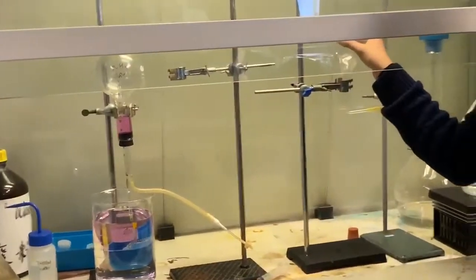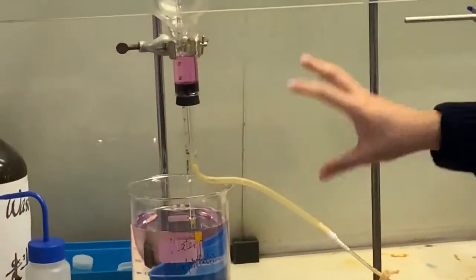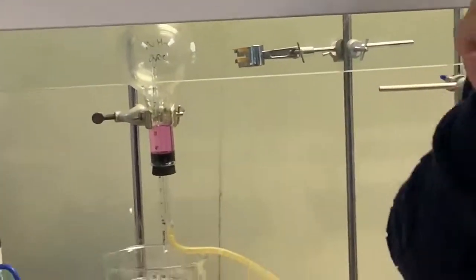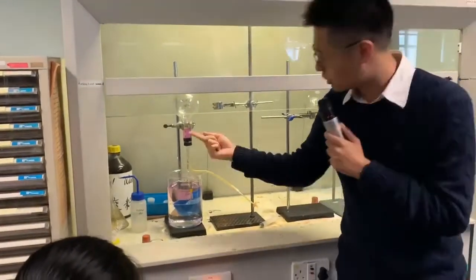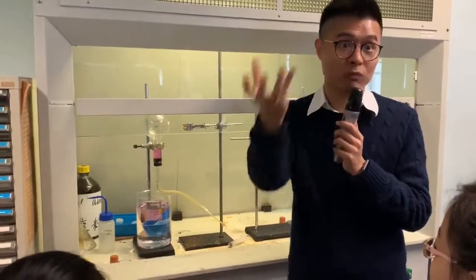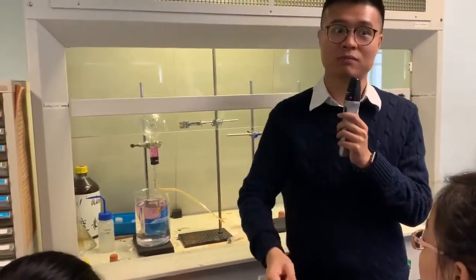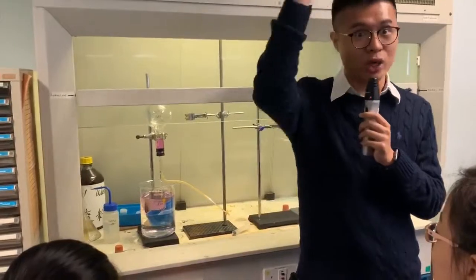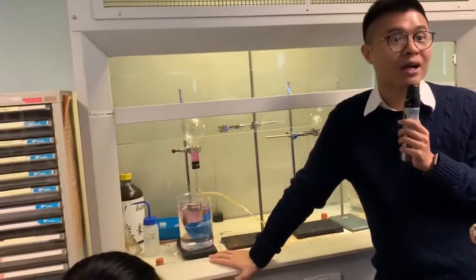So after we pack the ammonia, then we can do it. But what is the purpose, right? We check if ammonia loves water or not. It's like on here, you see. They go up. They absorb the water. Why do they absorb the water? Because ammonia loves water. Because they really love water. Ammonia and water.